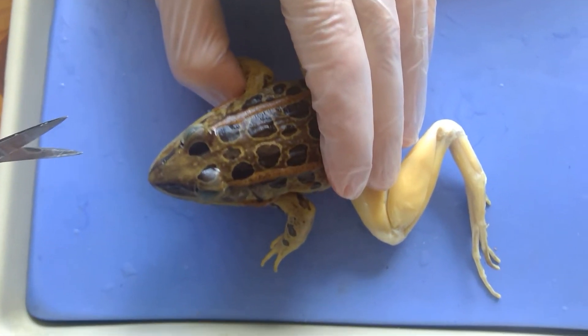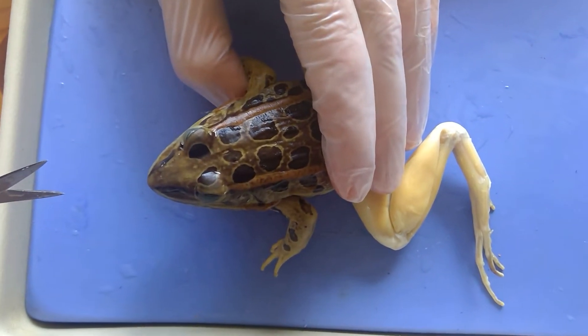All right, for the second part, what we're going to be doing is the mouth dissection.